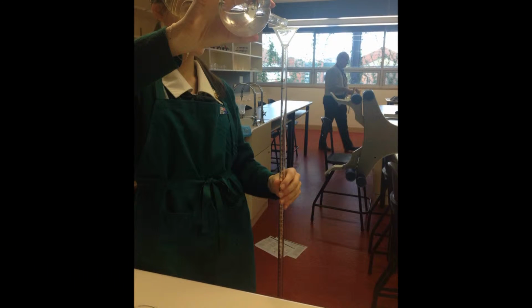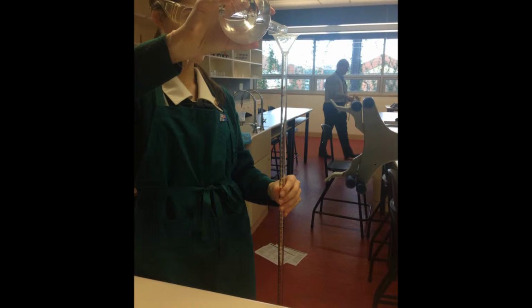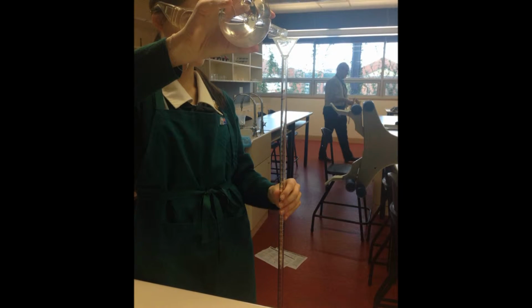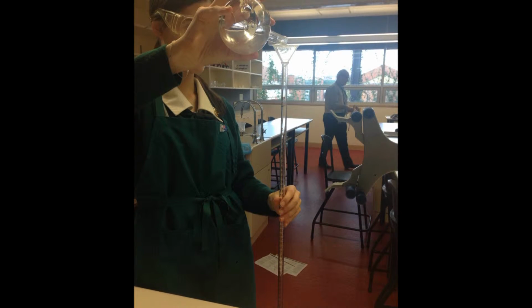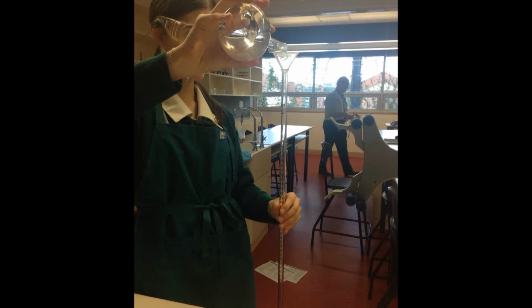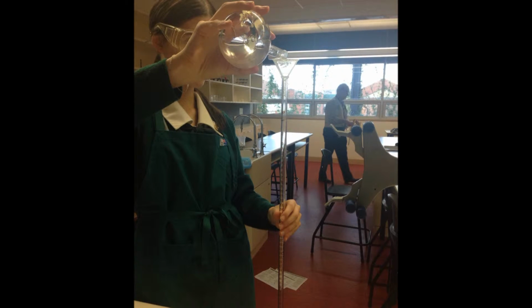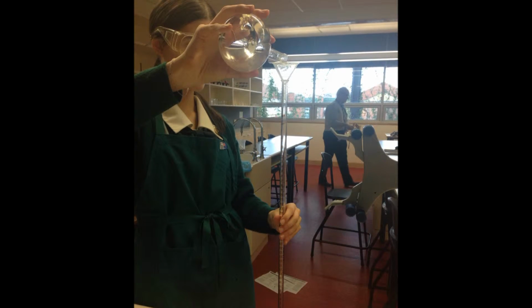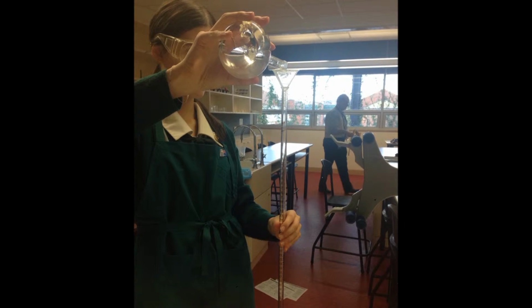Step 2. After rinsing, add the standard solution to the burette. This is known as the titrant. Carefully note the starting position of the burette to avoid parallax errors in reading the meniscus. To avoid errors, allow the starting position to be at 0. Ensure that the burette contains no air bubbles. To do this, hold the burette at a vertical angle and rotate.